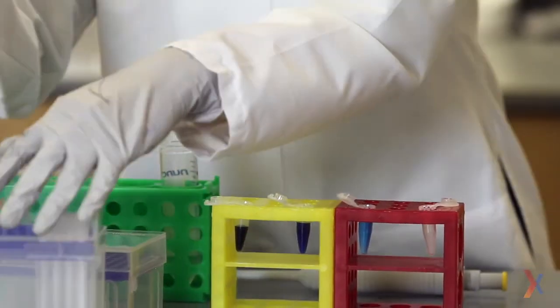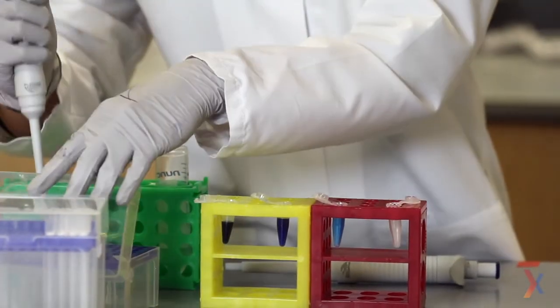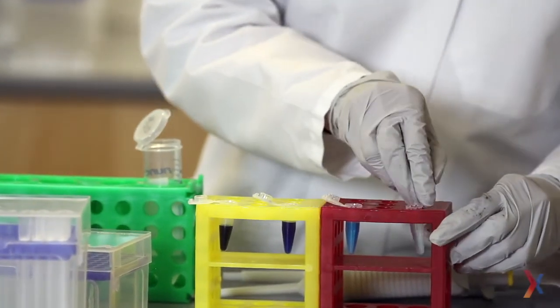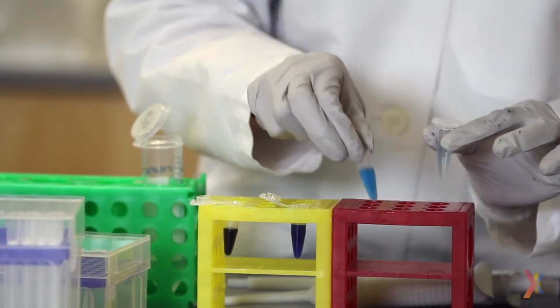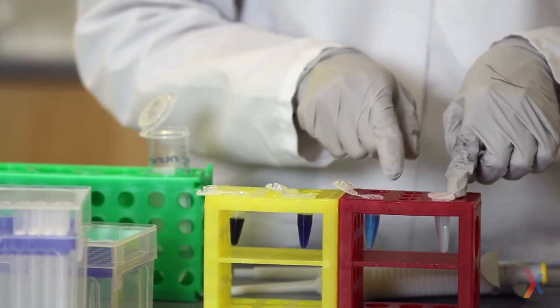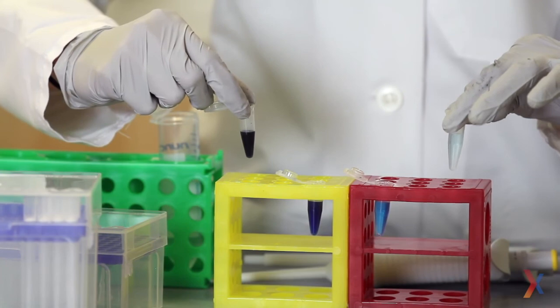I will repeat that one more time, taking 900 microliters of water and mixing it into this tube with 100 microliters of the solution I just made. I close the cap, give the tube a good mix, and you'll see the color has become even more dilute. We just determined that the previous tube was a 1-to-100 dilution of the original, so if I take a 1-to-10 dilution of the 1-to-100, what I've effectively done through these three series of 1-to-10 dilutions is create a 1-to-1,000 dilution of my original solution.